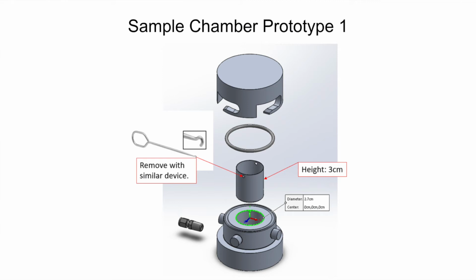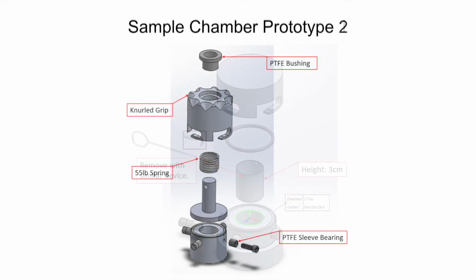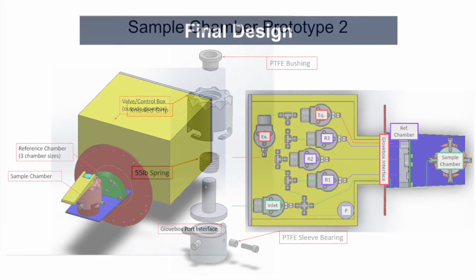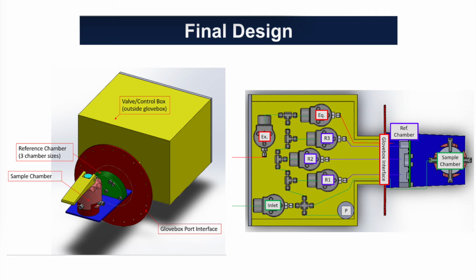The first design iteration utilized a quarter-turn camming latch closure that was very repeatable, but the shearing of the sealing face and the O-ring was deemed a possible point of failure. The second design iteration kept the camming latch closure, but added a sealing piston that was driven by a spring in order to compress the O-ring for a sufficient seal, and to have a repeatable mating face between the bottom of the piston and the top of the sample chamber. The camming latch pins were replaced with screws for improved manufacturability. An ergonomic grip was added to the lid for improved usability, and improved PTFE bushings were added to the points of shearing metal-to-metal contact. The final design was reached after extensive analysis and with care taken to meet the spatial and material requirements of Johnson Space Center.